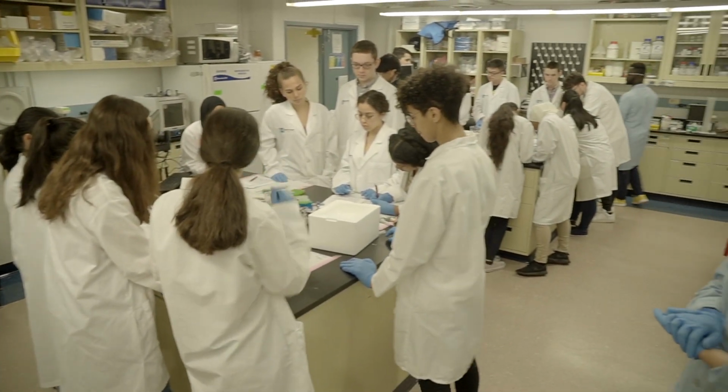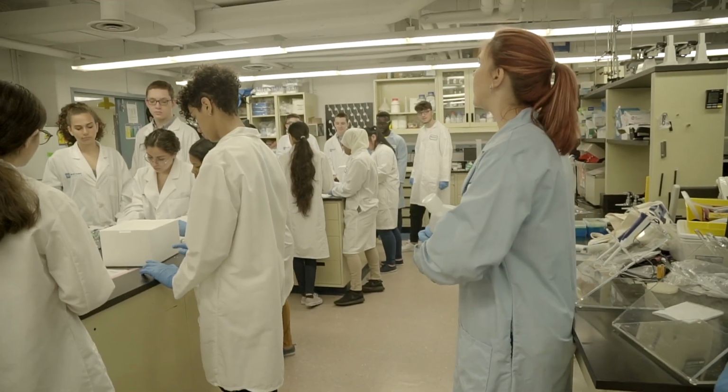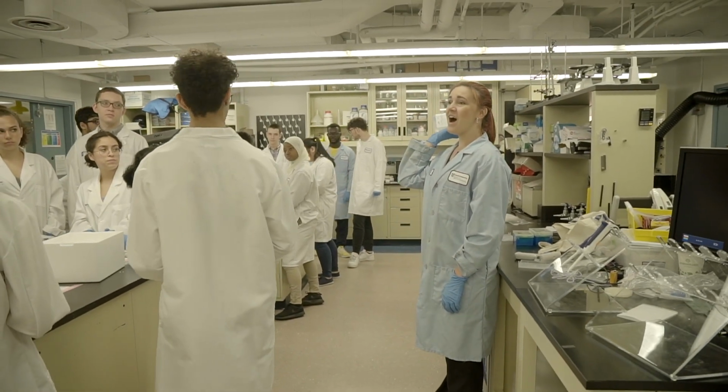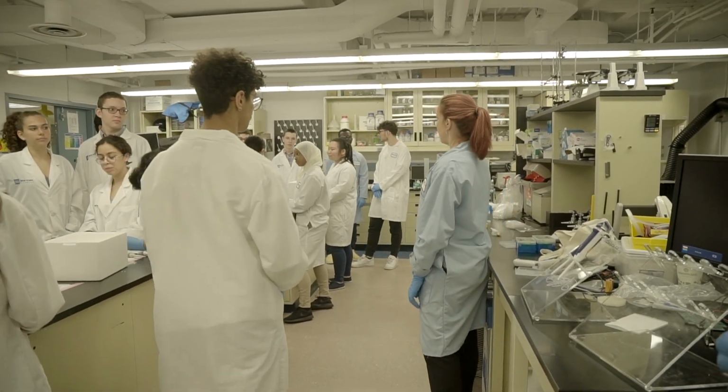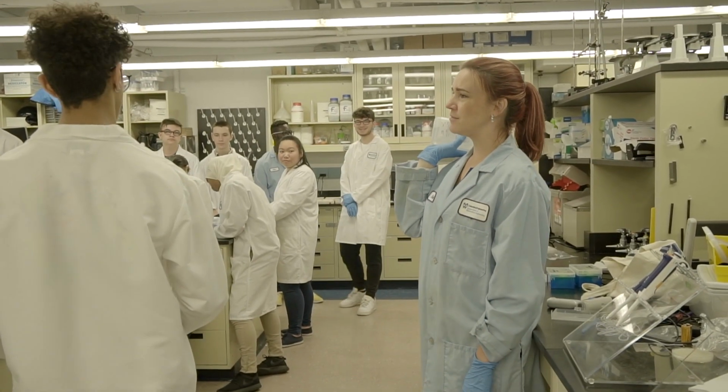Almost everything went in between 11 and 15. All right, does everyone think they figured it out? So altogether, how much of the TAE buffer do I need? 100, right? Does everyone get that? And how much water am I going to need? 900. Am I going to use tap water?